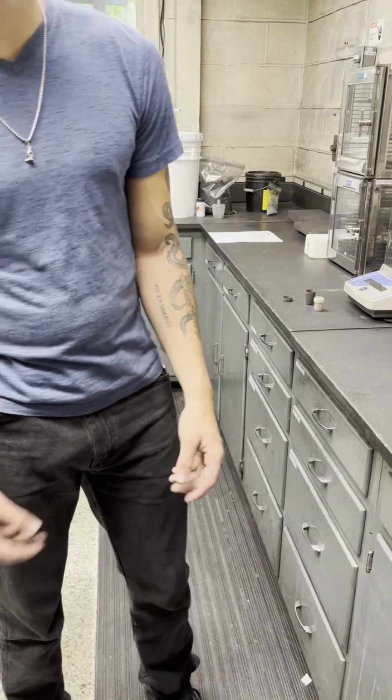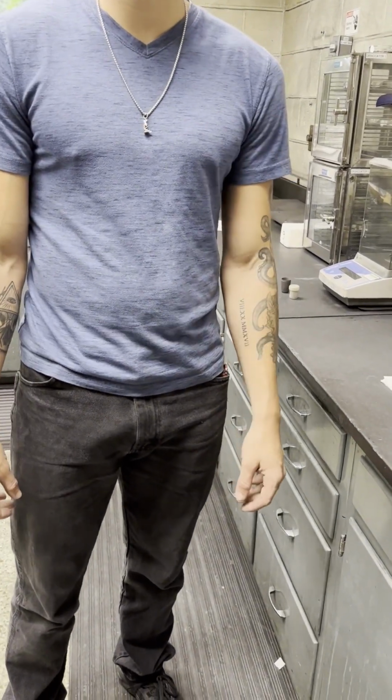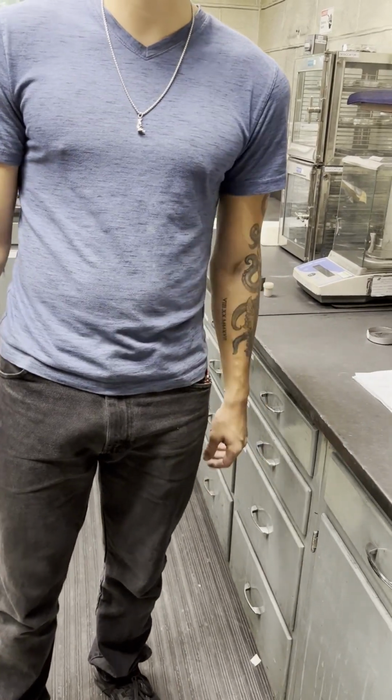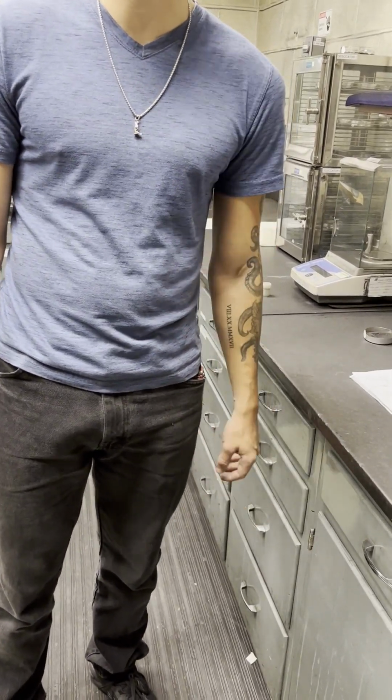Allison. We're at Technical Services today, and we're going to be reviewing volatile matter content. Today, I'm going to show you how to determine volatile matter content in our materials.